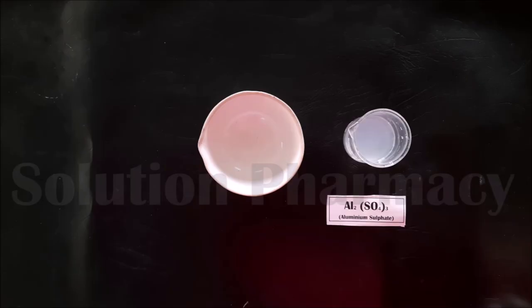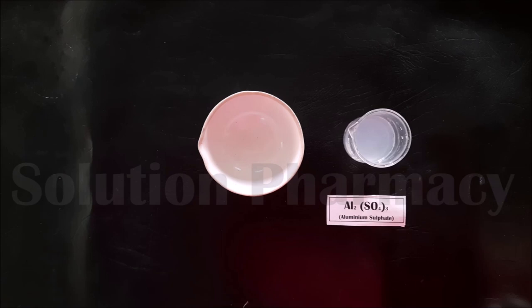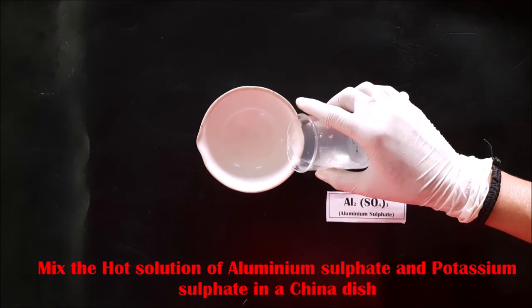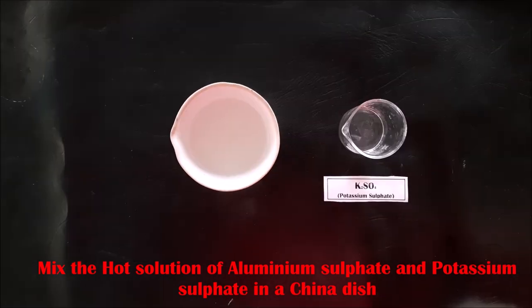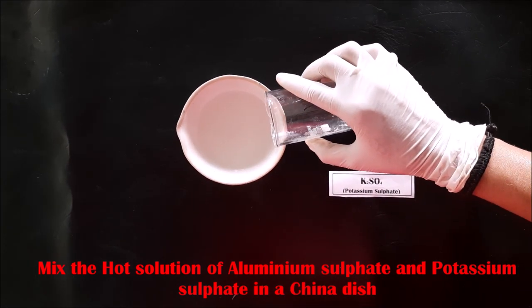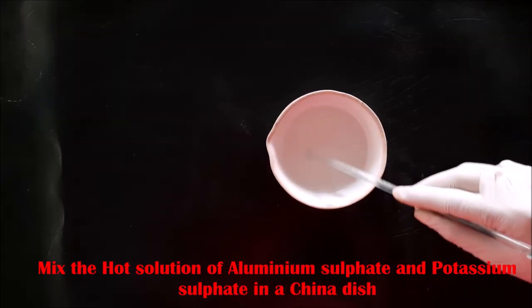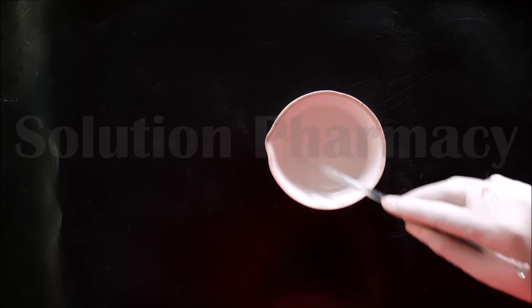After this, mix the hot solution of aluminum sulfate and potassium sulfate in a china dish. First transfer the hot aluminum sulfate solution into a clean and dry china dish, then add the potassium sulfate solution prepared earlier into the same china dish. Mix both solutions with the help of a glass rod.